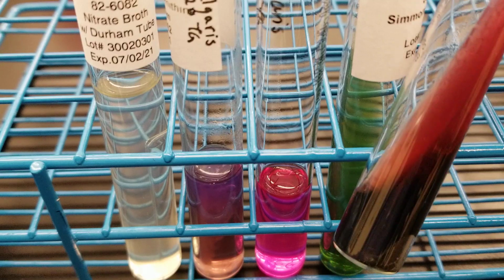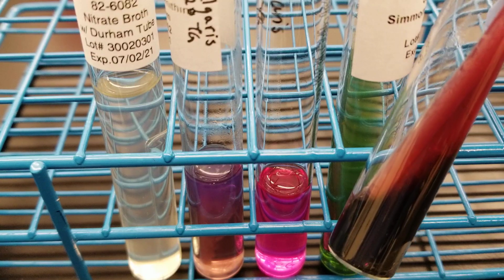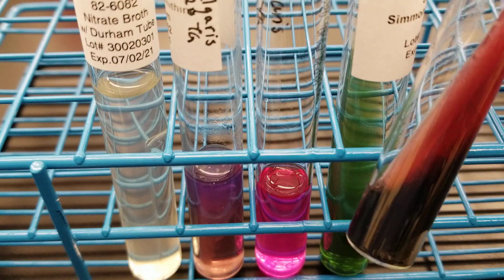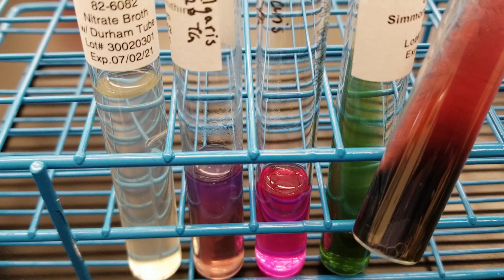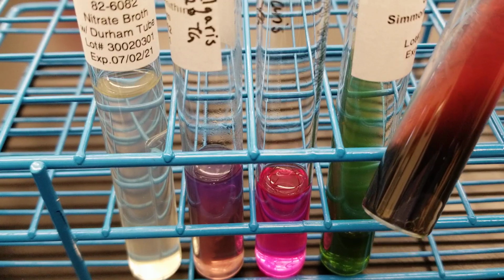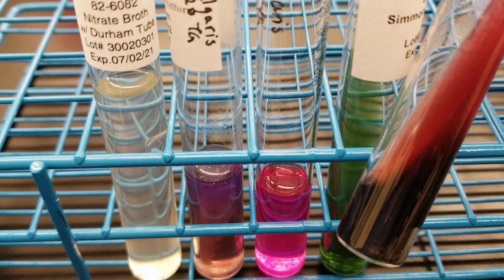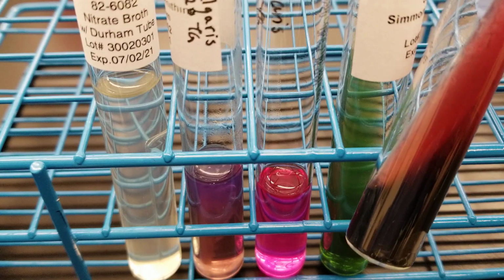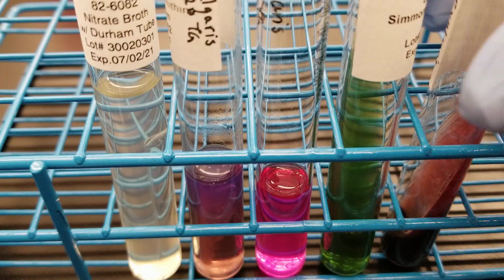So anytime that you have a blackening of the media, that means it's an acidic environment, okay? It has to have been an acidic environment to be showing the H2S positive, or the blackening of the iron in there. You do see gas here, so we can say that this is K over AG and H2S positive, and that's absolutely perfect. Another possibility would be A over AG, but that's not what we have.